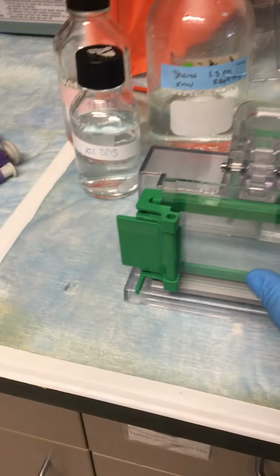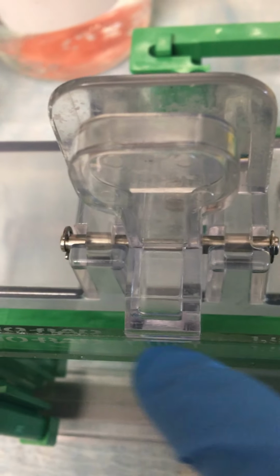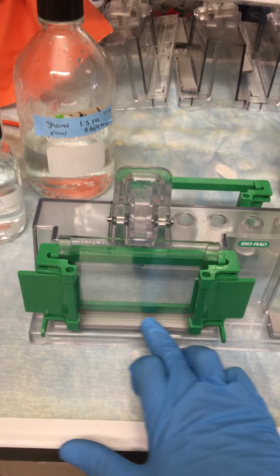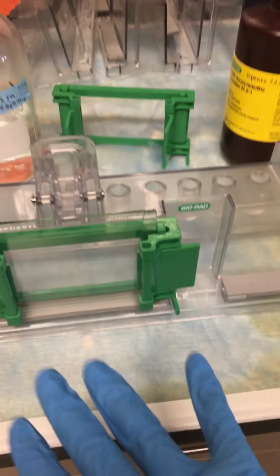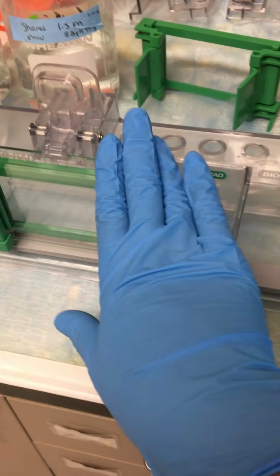So we're going to be pouring liquid into this little window in there, and the liquid is going to turn into a gel. But sometimes, if you haven't really set this up nicely, the liquid will leak out of the bottom, and then your gel leaks and you have to redo it. So that's why people hate pouring gels. That's really the annoying part of it. It's not so much actually the system itself, but it's that a lot of times these are going to leak, and that'll drive you crazy. So just double check that this is on, and be careful when you're setting up your glass.